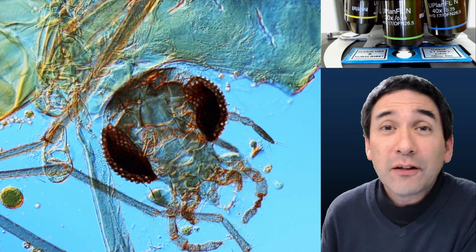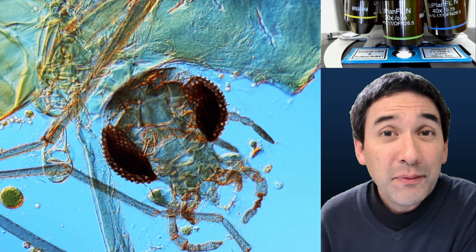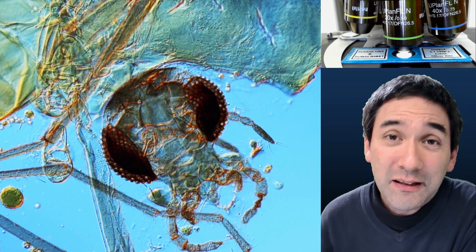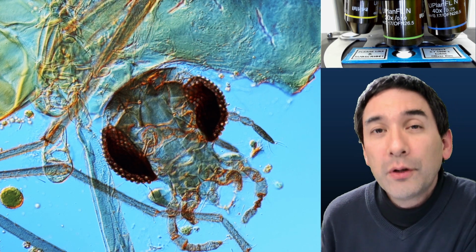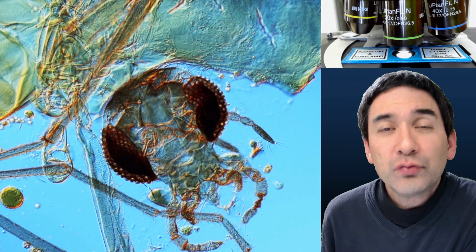A second recommendation that I have, or a second improvement that I would do, is I would actually put the insect first into a little bit of alcohol. I've not done that. The insect has been directly mounted. I caught the insect and put it directly into the mounting medium. I don't even know if I would do that again like that. But I would put it first into alcohol. And the alcohol actually does 2 things. First of all, it does remove the water.